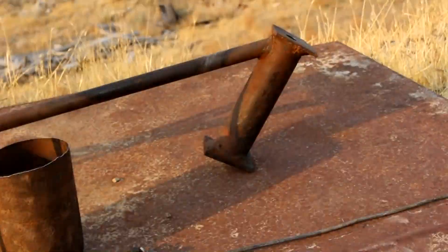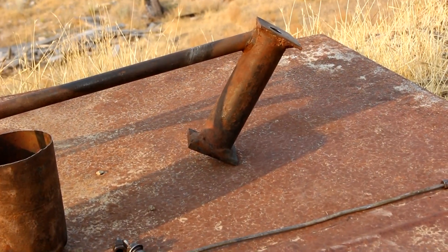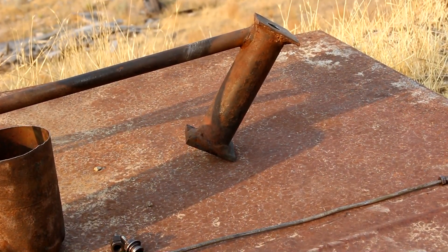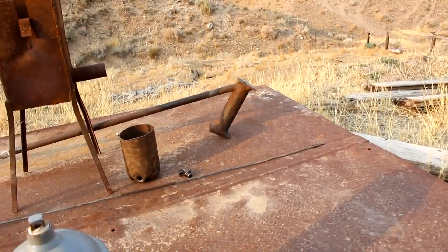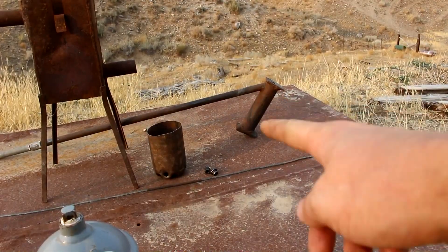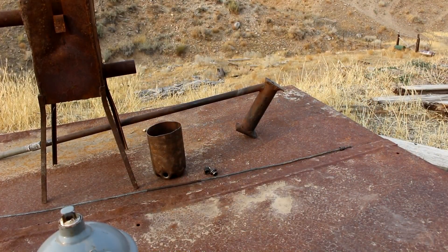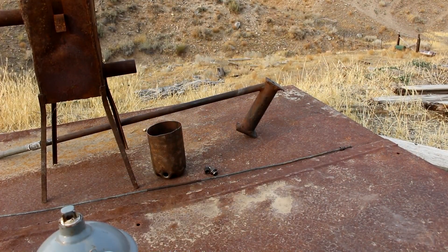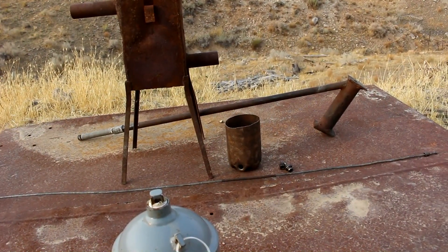So I want to do something with small quantities. Like this little distillation apparatus I've built — something about that size I think I can handle. If that explodes, it's not going to be an environmental disaster. But if I do something that small in batches, I'm going to be doing dozens of them and it's going to take me forever. So I was thinking what I'm going to do is actually use a continuous feed process.